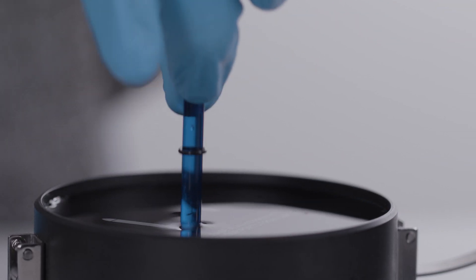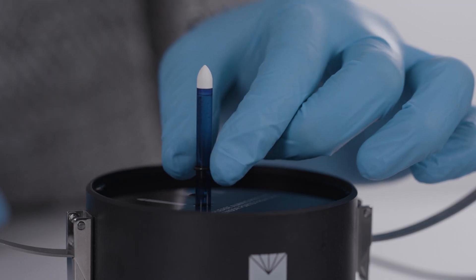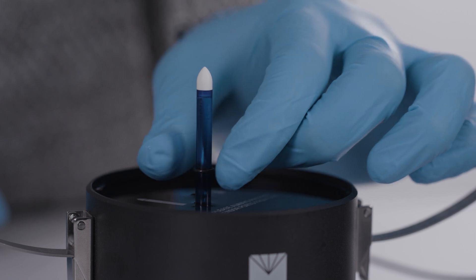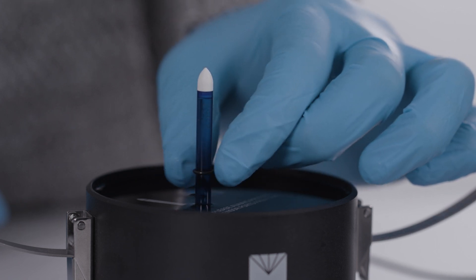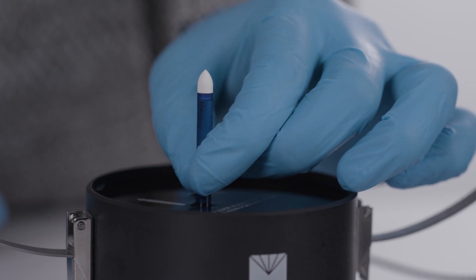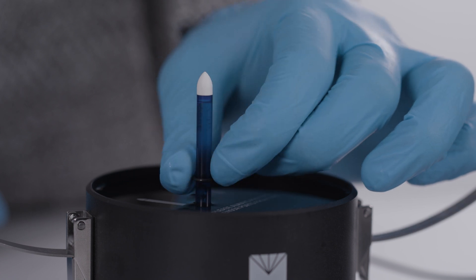At an angle, lower the tensio shaft to the labeled sensor port. Screw in the tensio shaft while monitoring the tension values on the screen. After about nine turns, the O-ring in the sensor unit begins to seal and the pressure increases rapidly. When this happens, screw in the tensio shaft by another quarter of a turn in slow steps, not all at once.